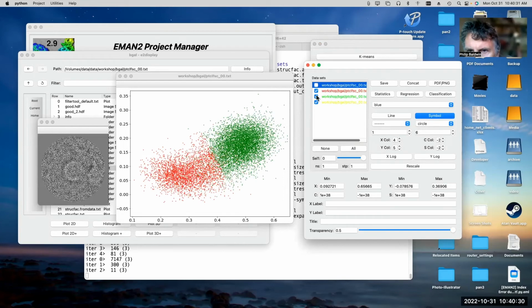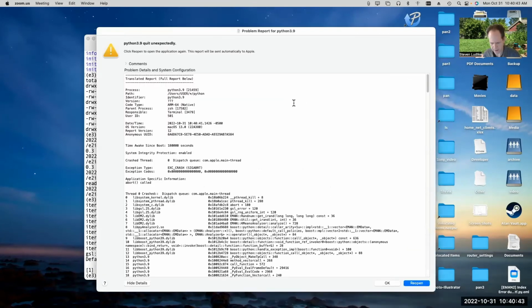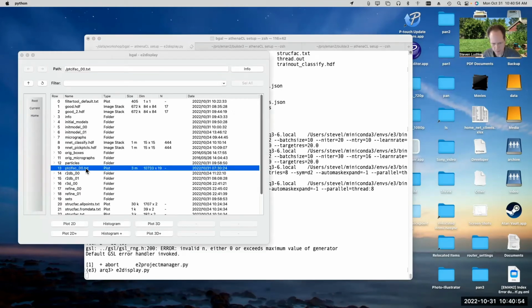Turn off the blue ones. So you can see the red are sort of the bad particles, and the green are the sort of good particles. I'm not sure why I didn't get any yellow that time. All right, hang on. I managed to confuse things somehow. Let me just do this one more time really quick, and we'll wrap things up.